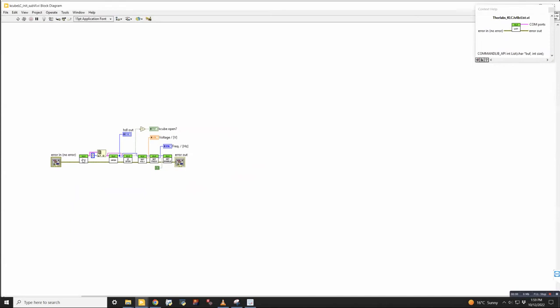So there's probably like 40 or 50 or 100 different things that you could do with this. And all we wanted to do was turn it on and set the voltage and keep it there. So surprisingly simple things are complicated to do because they try and pack so much functionality into one thing. It's always worth it to try and find the most simple, smallest low level VIs that you can find from the manufacturer and piece those together in the order that makes sense for what you're doing.